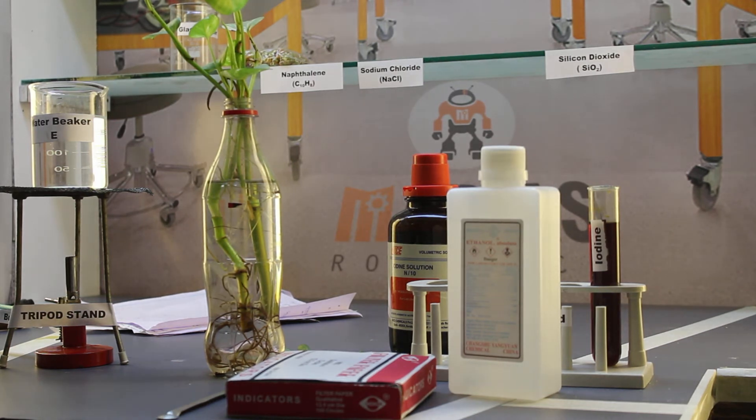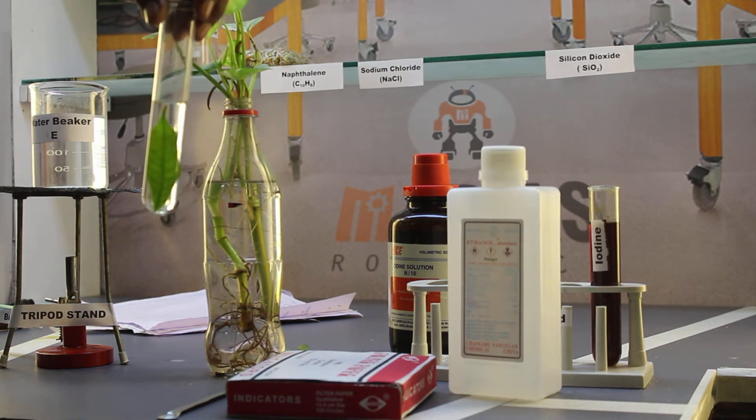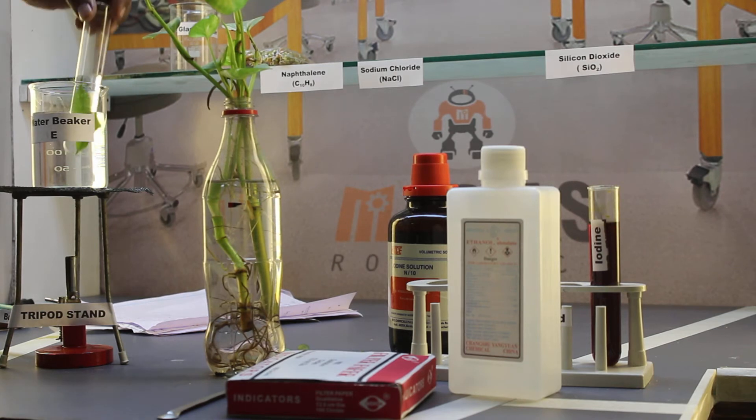Now place this test tube which is filled with ethyl alcohol along with the leaf in a water bath.